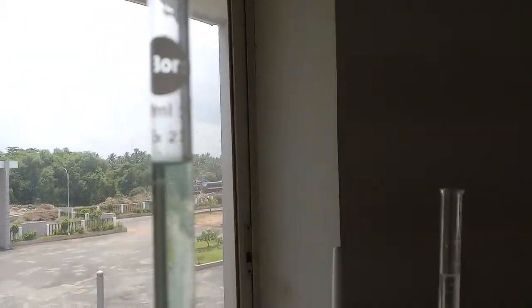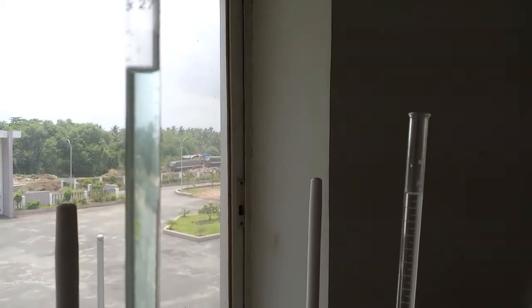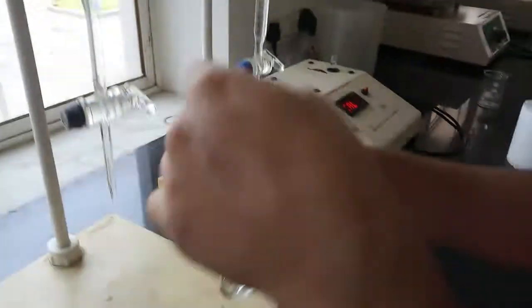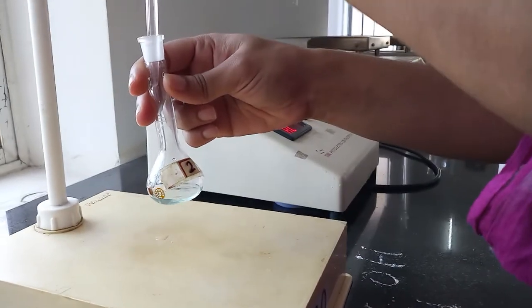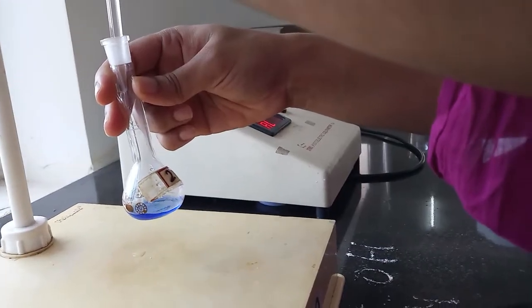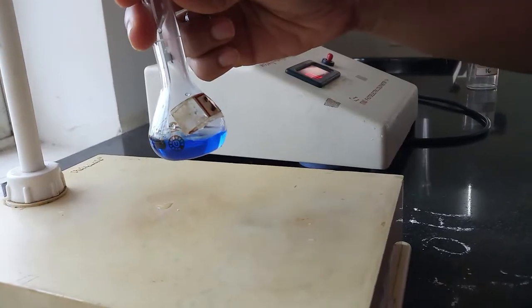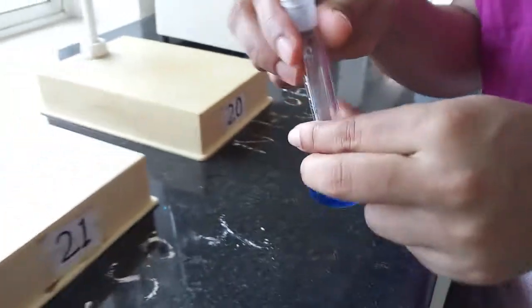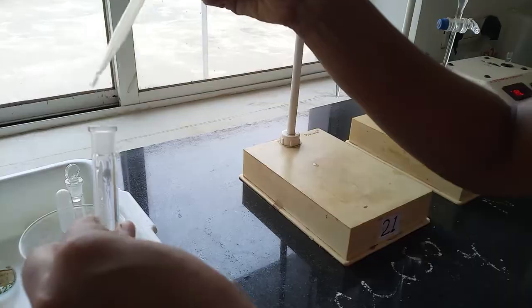Here, first let us add just 2 ml of copper sulfate solution from the burette. After transferring 2 ml of copper sulfate, we add 5 ml of ammonium hydroxide. On adding ammonium hydroxide, it forms a cuprammonium sulfate complex, which is dark colored. Then the rest is distilled water, added up to the mark.